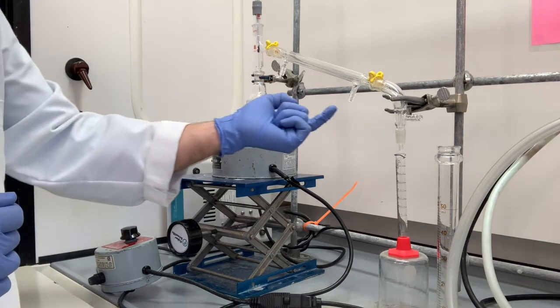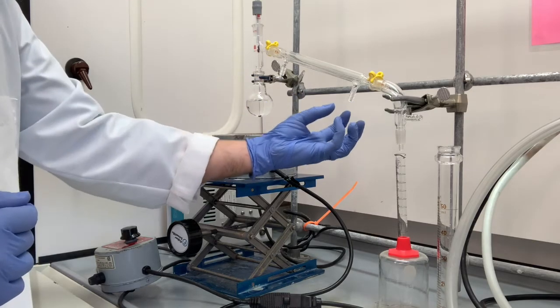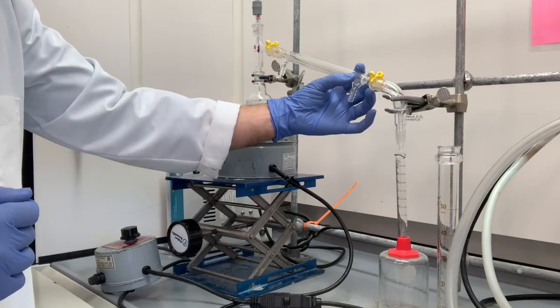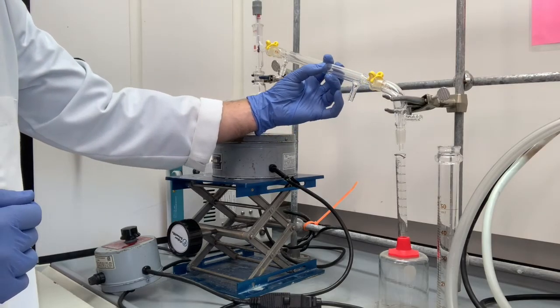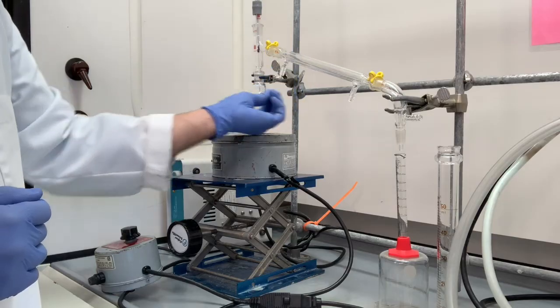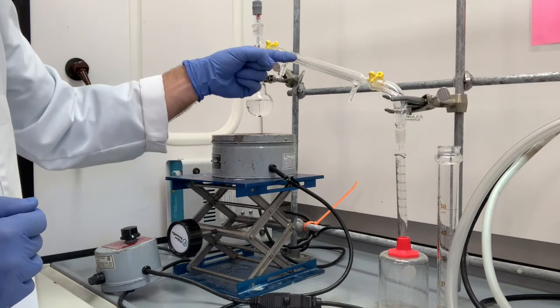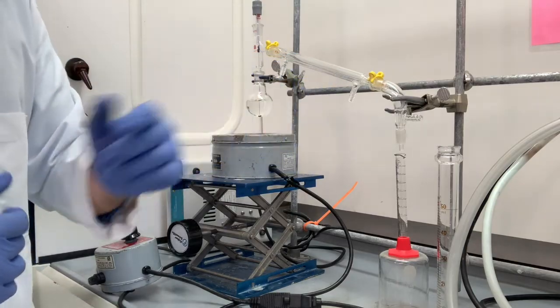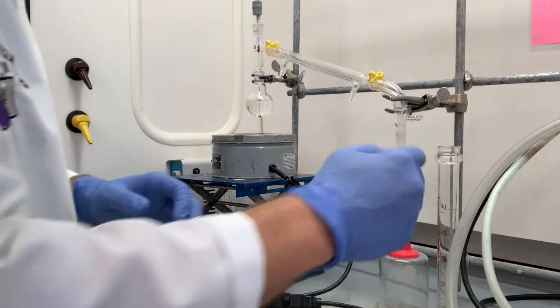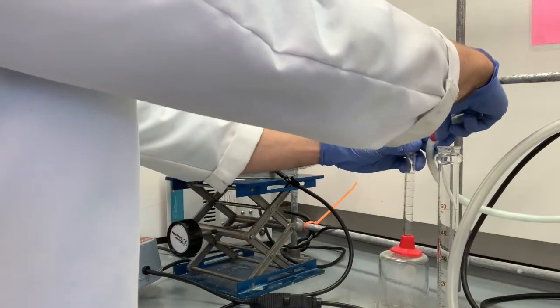Well, we're going to want the cold water to enter from here and exit here. The reason is, as we come up from the bottom, gravity will cause all the liquid to stay and fully fill the jacket before it leaves. If we had the cold water enter from the top, we would just have a river at the bottom here flowing out. So let's connect that water source.